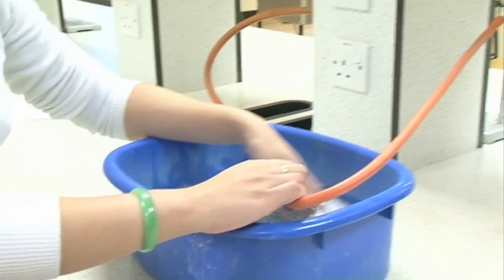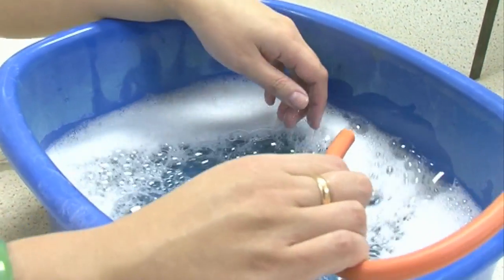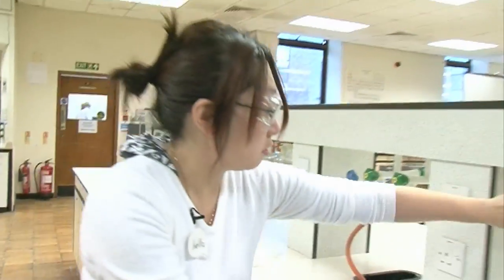So what we're going to do is actually use this to bubble methane gas into a soapy water solution. That's all it is, just a tub of soapy water. In it goes. Tap goes on.